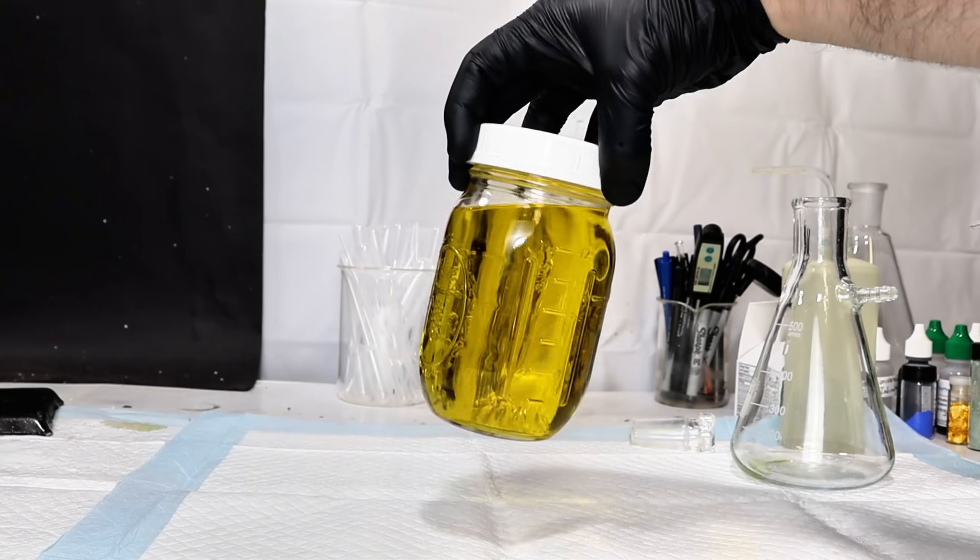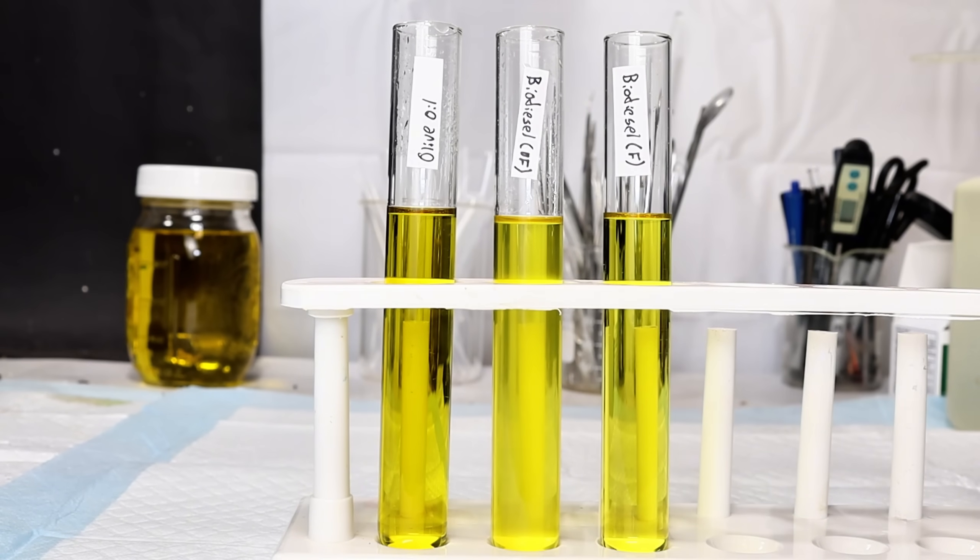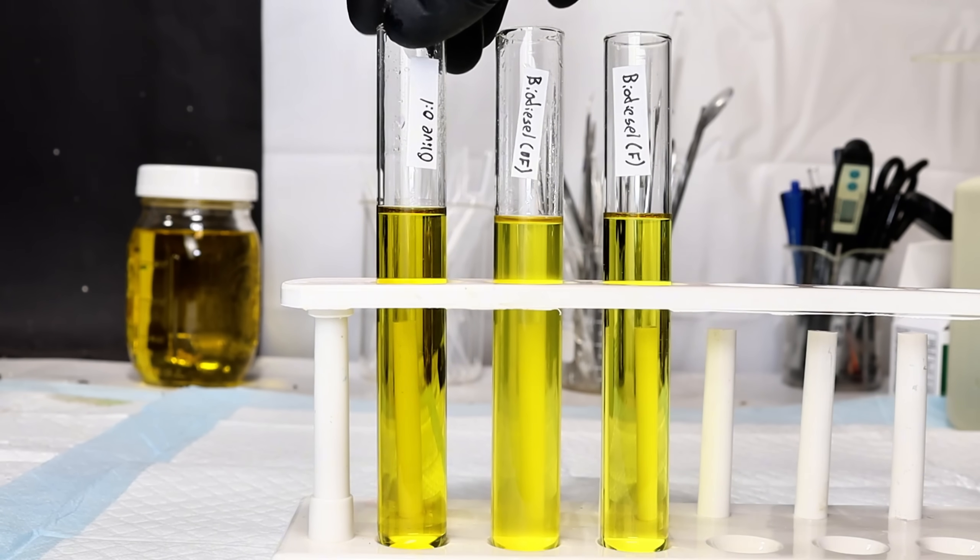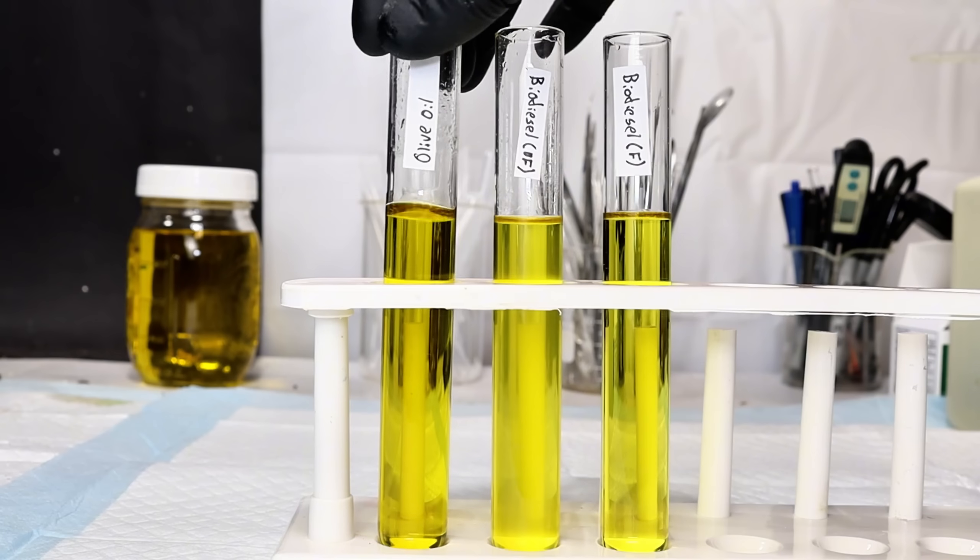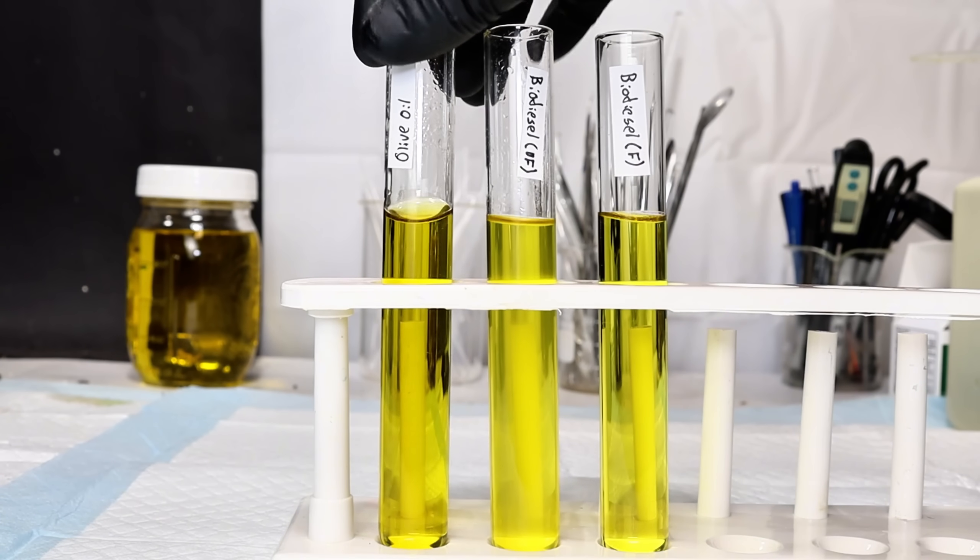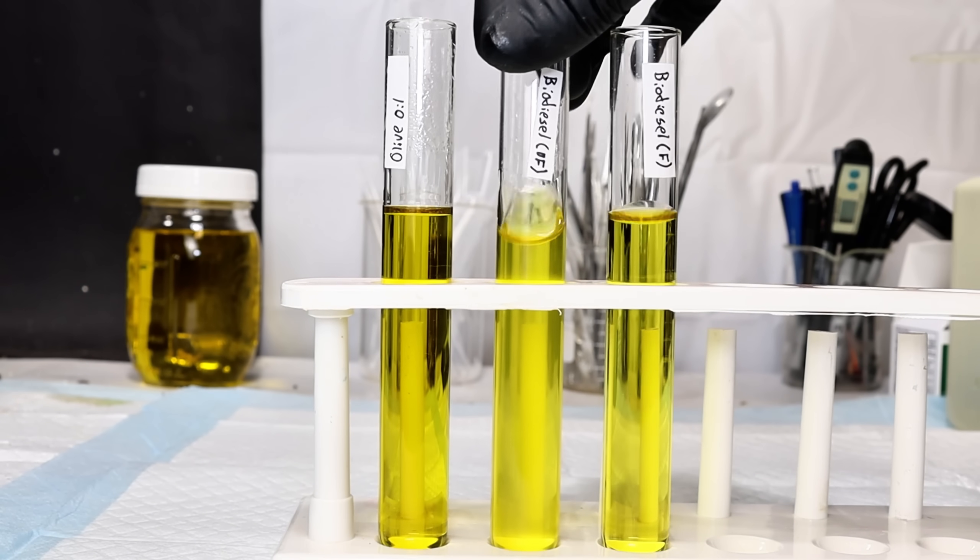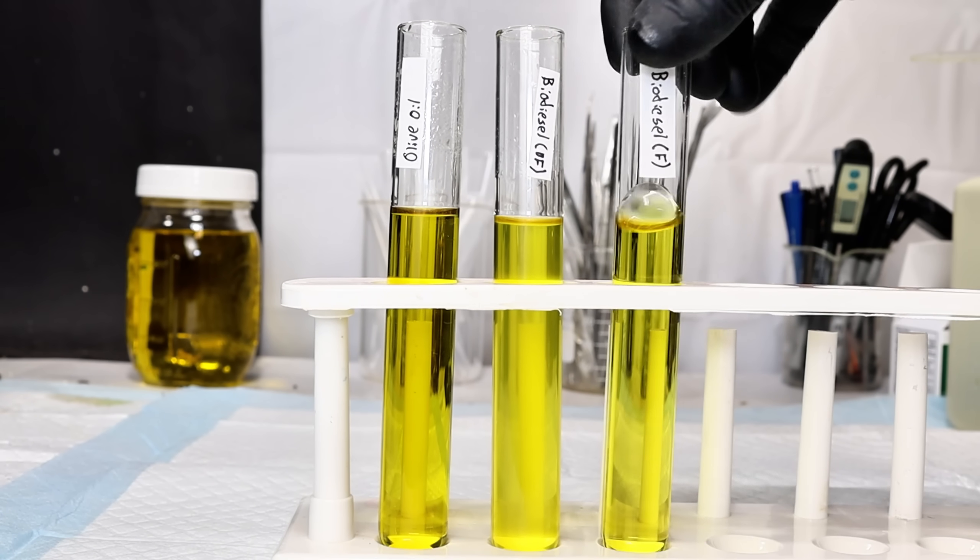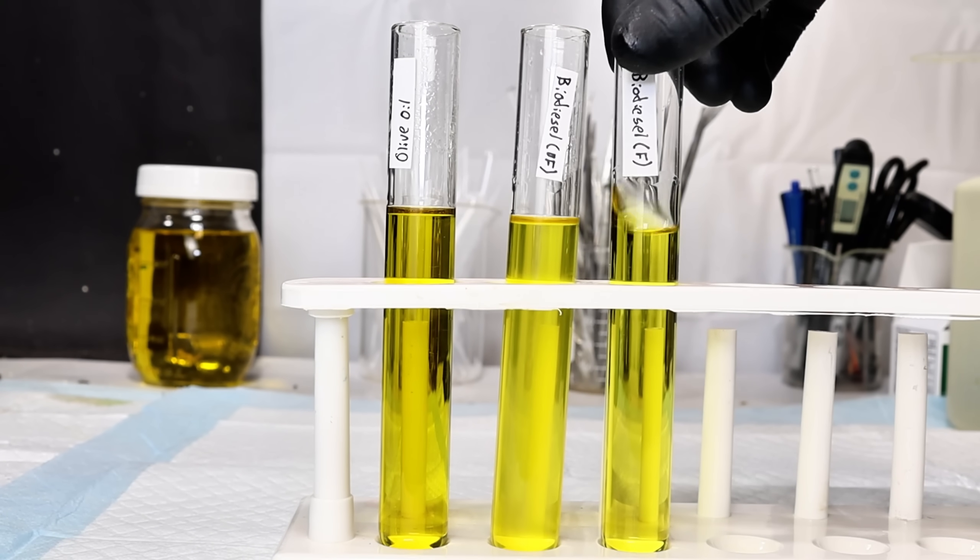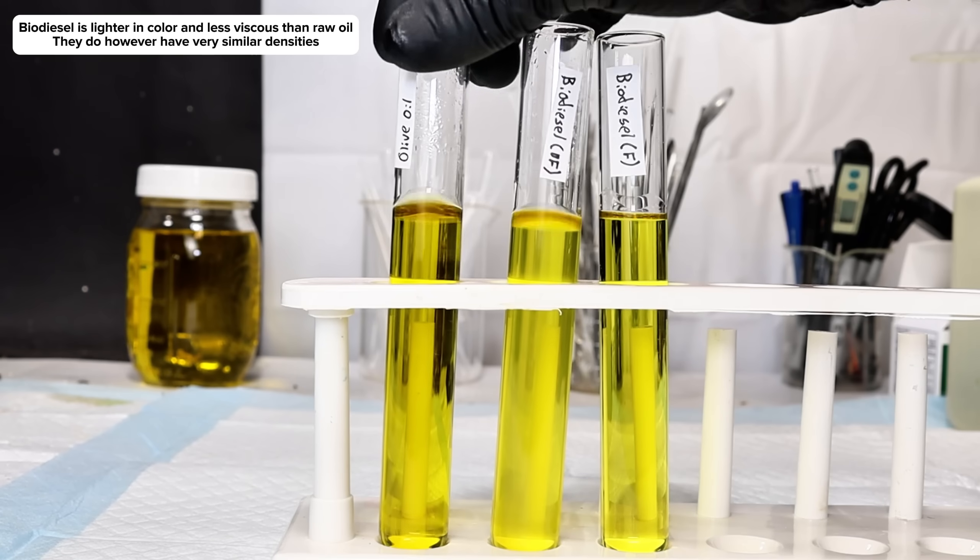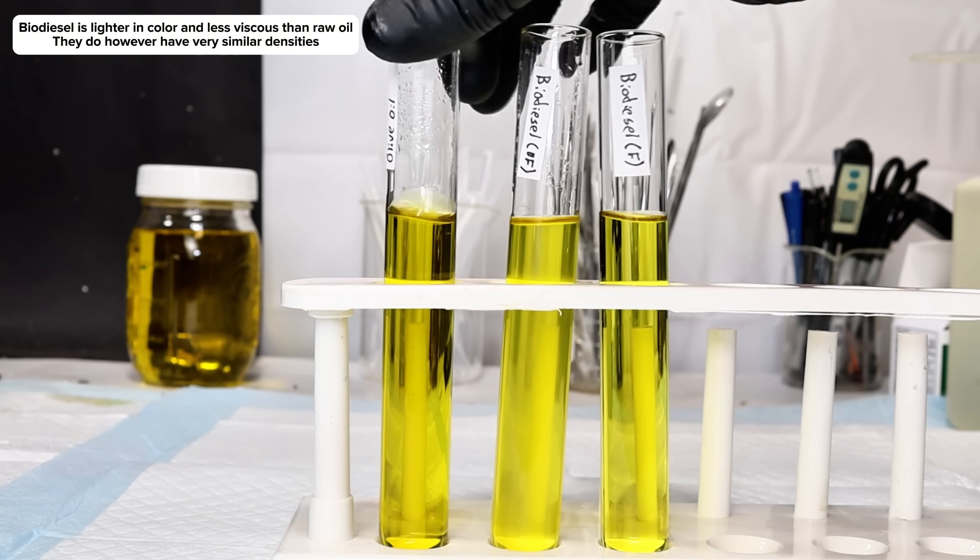Now, here I have three test tubes. The first contains unprocessed olive oil, the second contains a sample of my undried and unfiltered biodiesel, and the third contains my pure final product. As you can see, the biodiesel looks very similar to the oil, but it's distinctly lighter and contains none of the slight green hue that olive oil has.